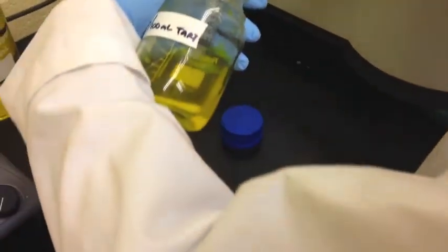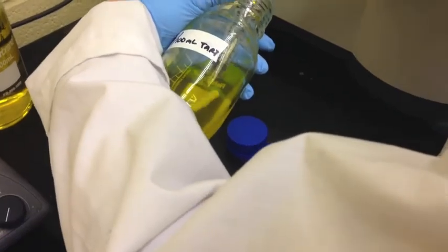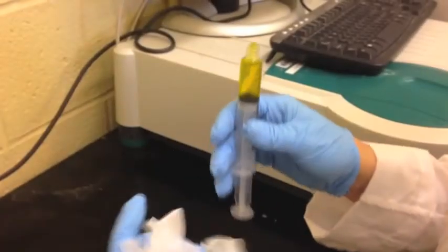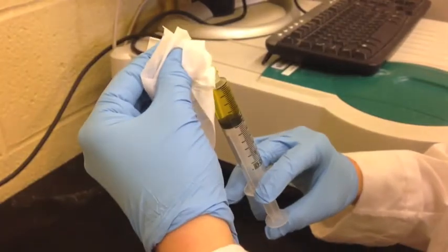The mixture of alginate and tartrazine was used to make hydrogel beads entrapped with dye. The syringe was loaded with 3 milliliters of the alginate-tartrazine solution. All air bubbles were removed from the syringe.